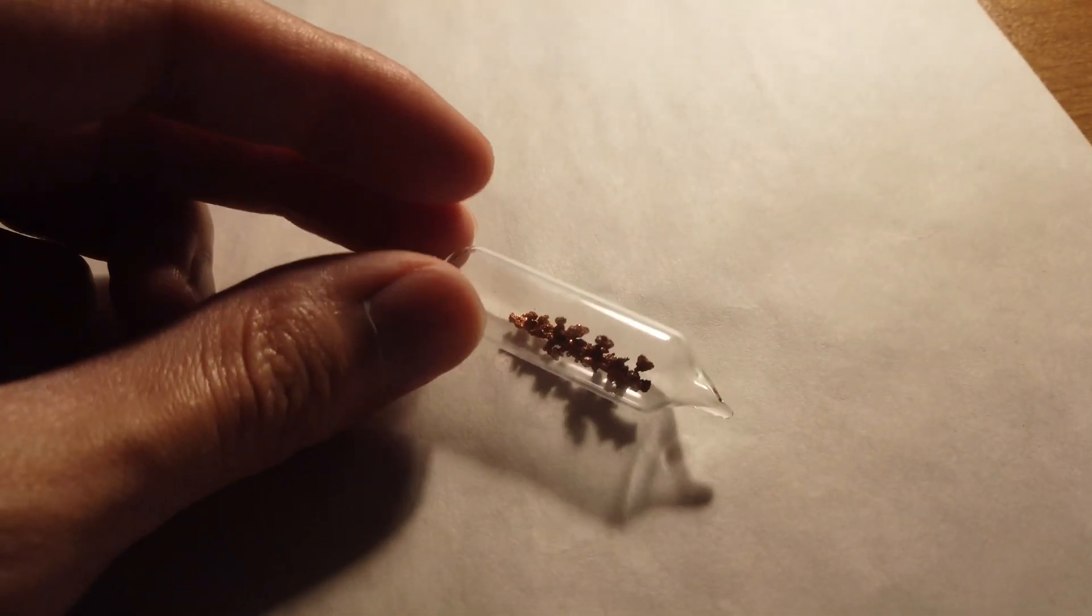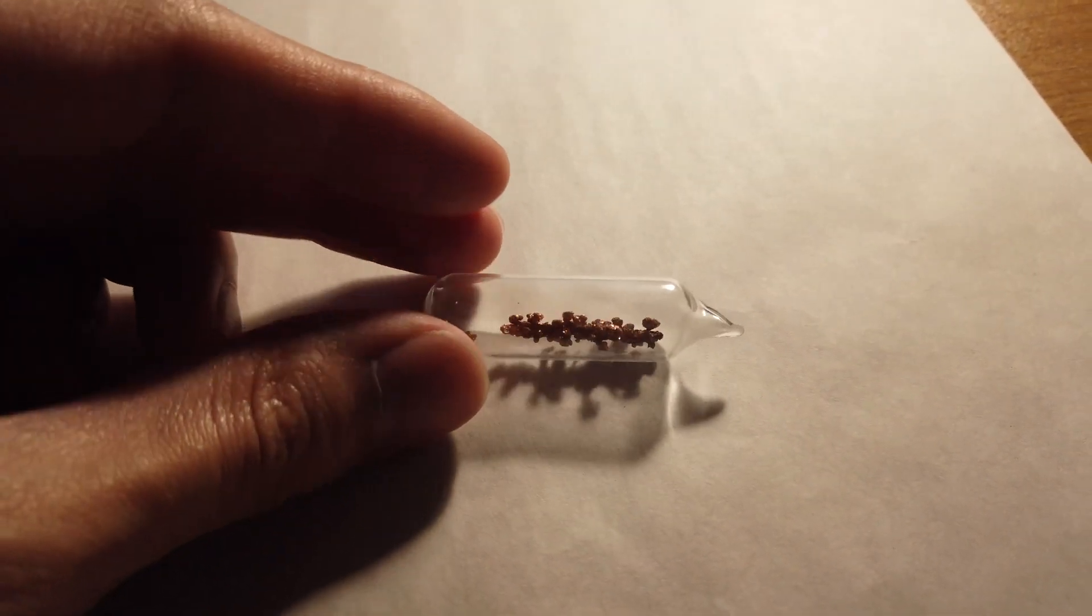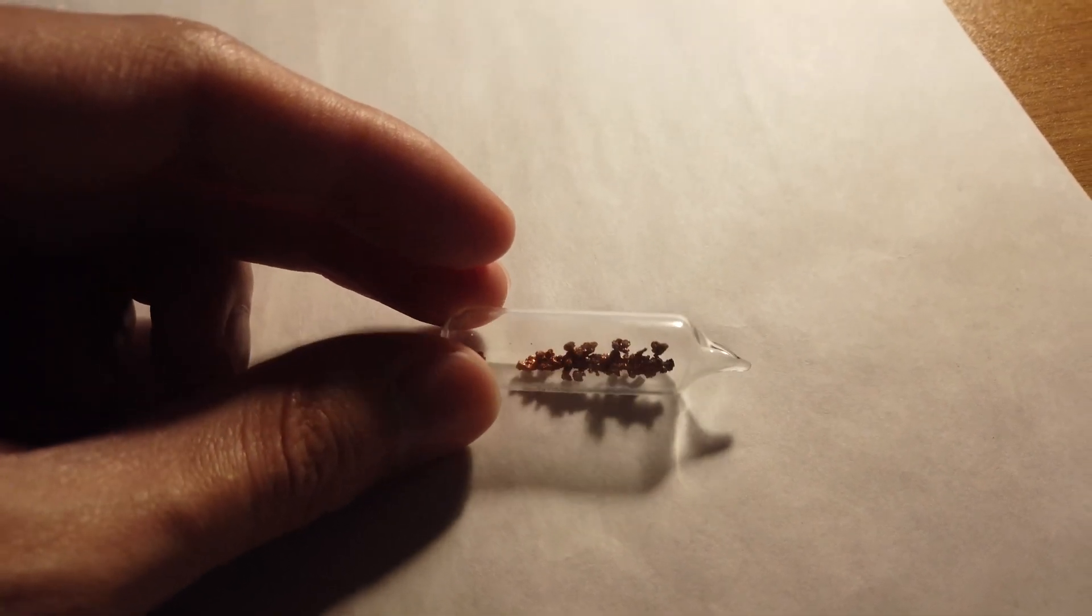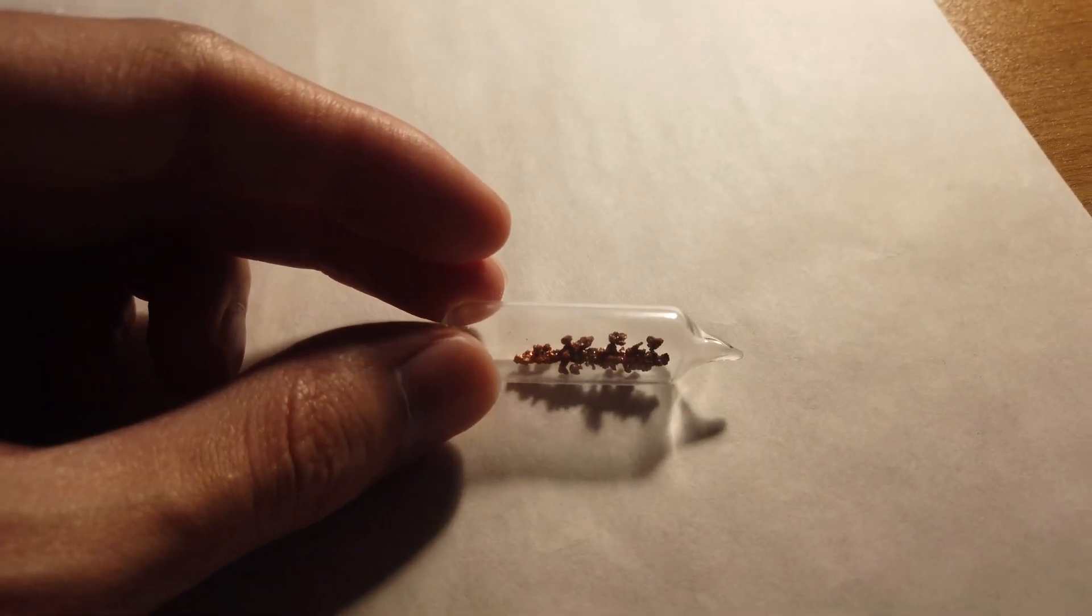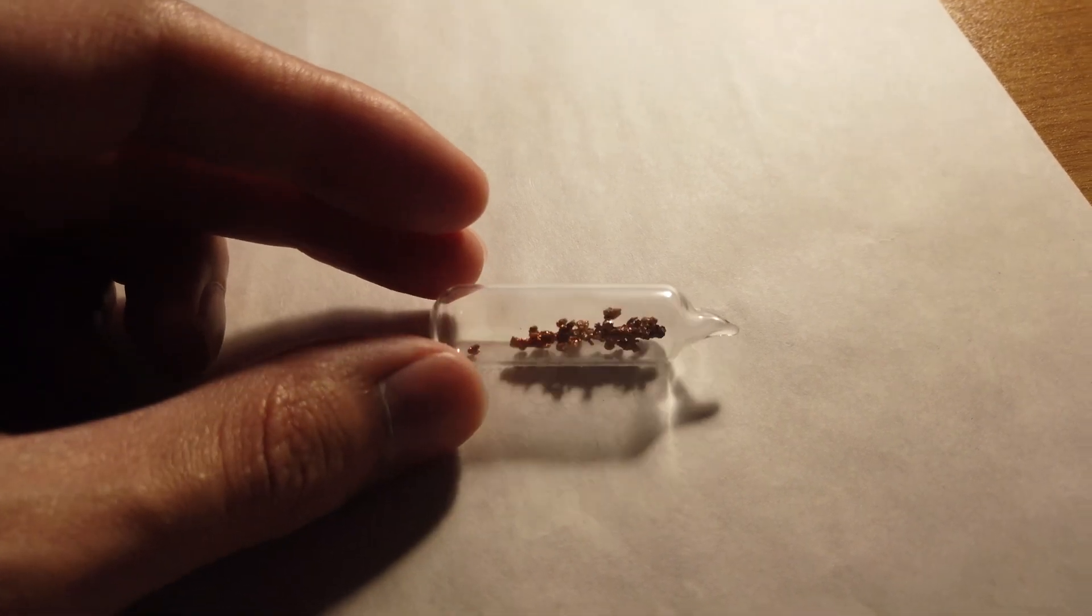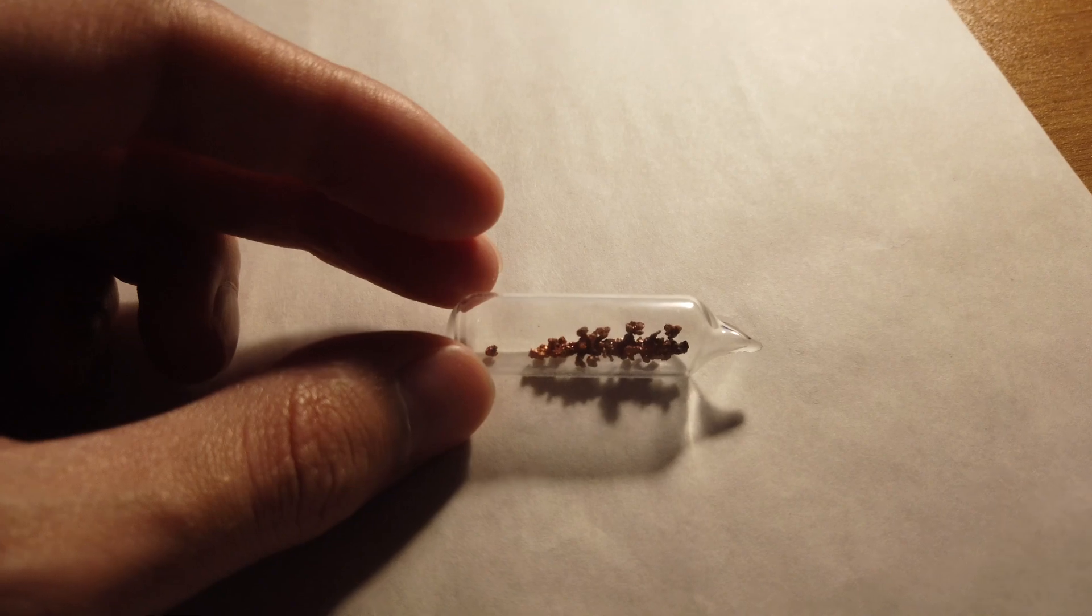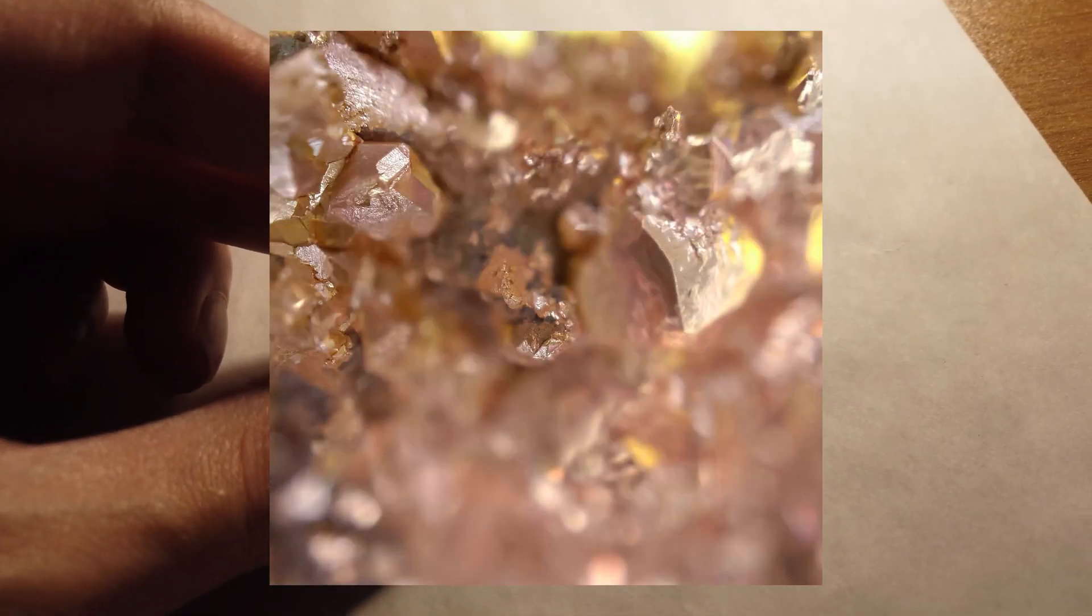All right, yeah, ampouling. I mean it looks cool in an ampoule but didn't really protect it from oxidation. I should have really ampouled it under nitrogen or argon, but that was a little bit beyond my capabilities. It is still somewhat crystalline and I was able to obtain some close-up shots before ampouling the thing.